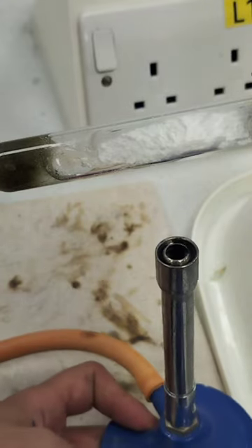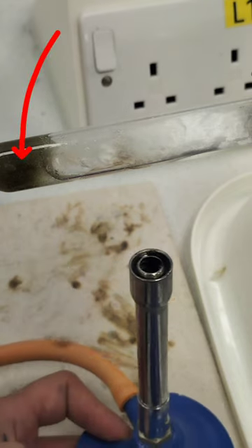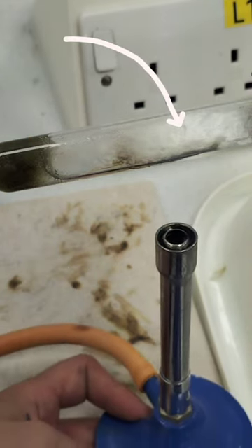This is a demonstration of a catalytic cracking experiment. What I'm doing here is I'm heating some liquid paraffin and passing the vaporizing paraffin over a hot aluminium oxide catalyst.